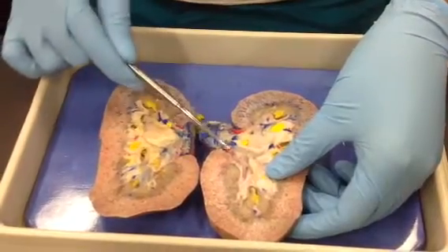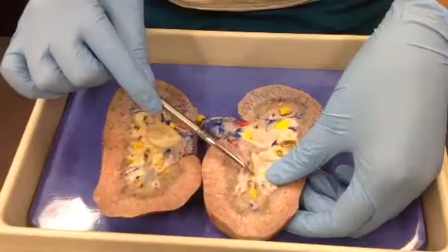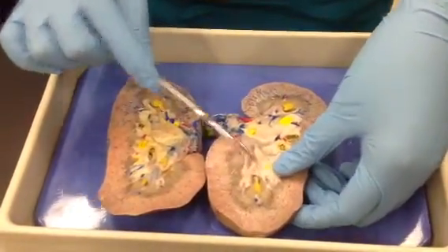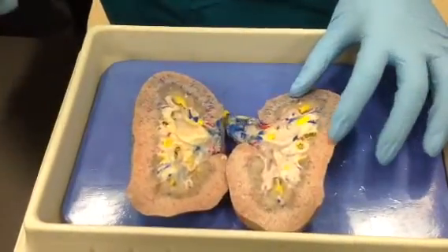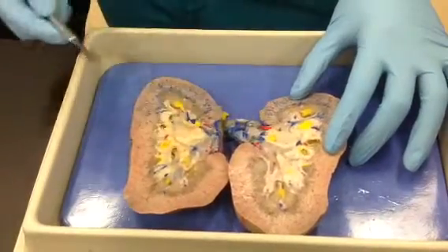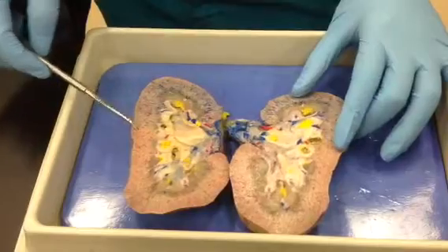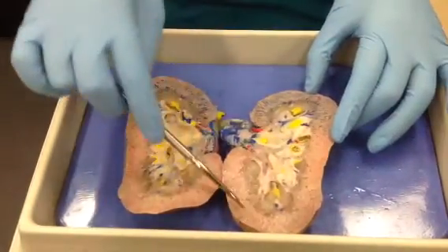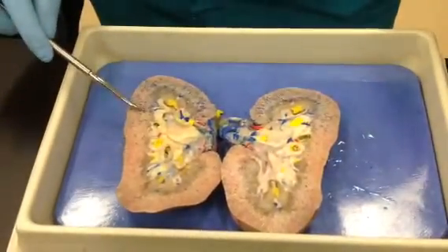So you'd have the renal artery come in and it splits into segmental arteries. This artery going here would represent an interlobar artery. Everywhere that you see yellow here is going to represent, of course, urine, and it's all found in the renal pelvis area of the kidney. Everything up here that's blue and red represents the cortical radiate arteries and veins, so those are the only blood vessels that are found in the cortex.